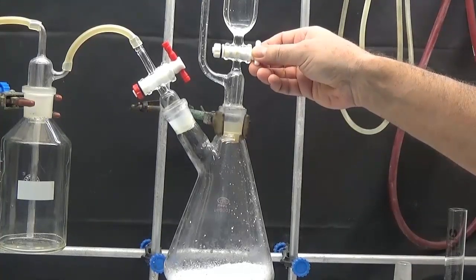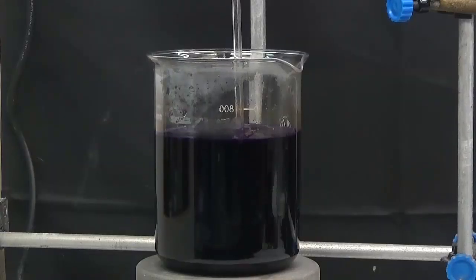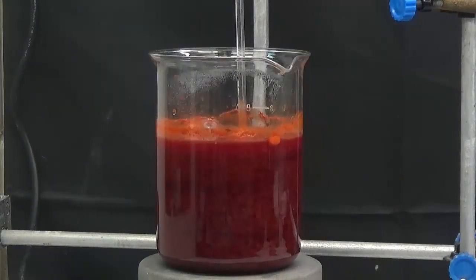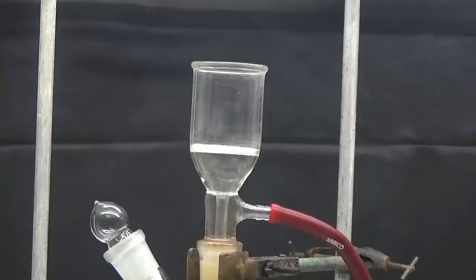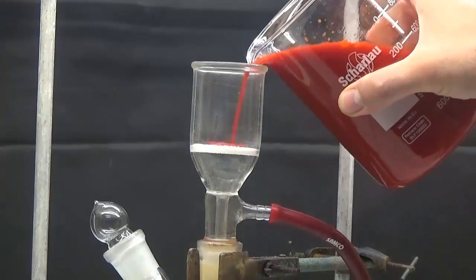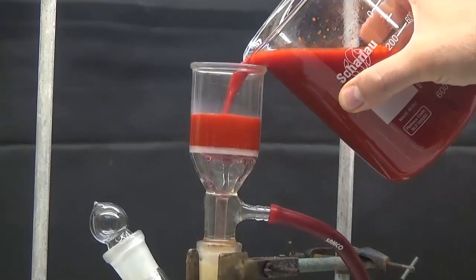The reaction is over when it turns red. Collect the precipitation by vacuum filtration.